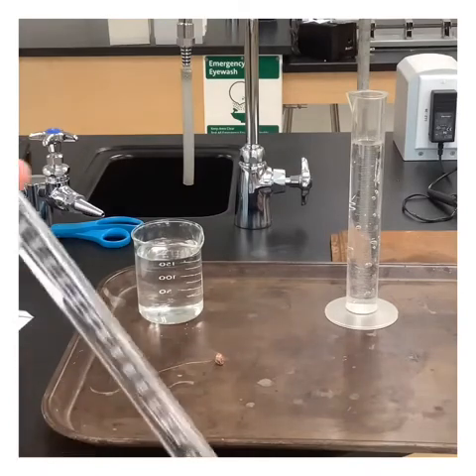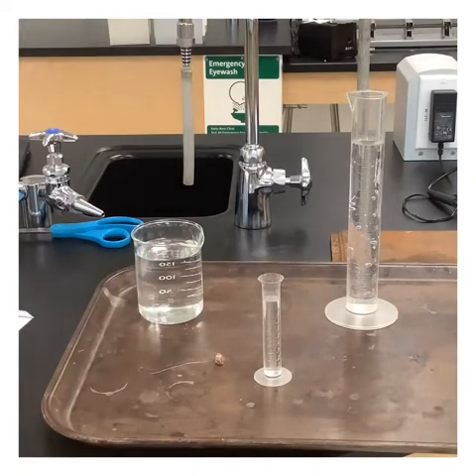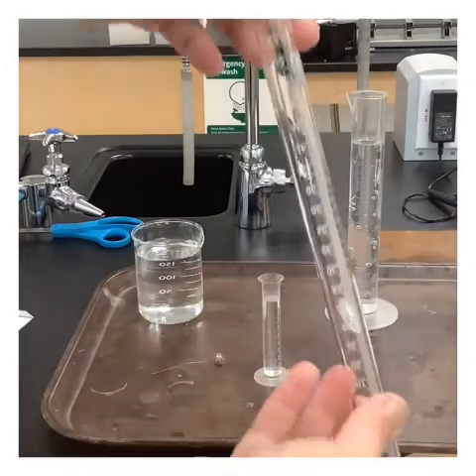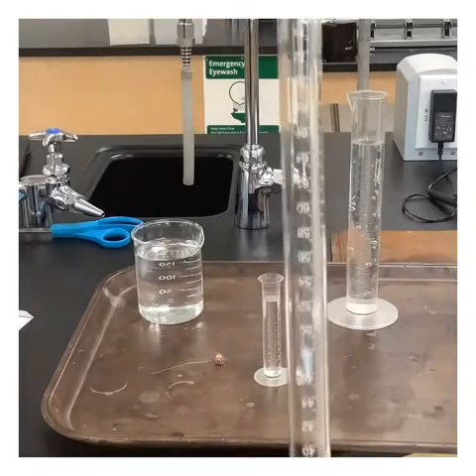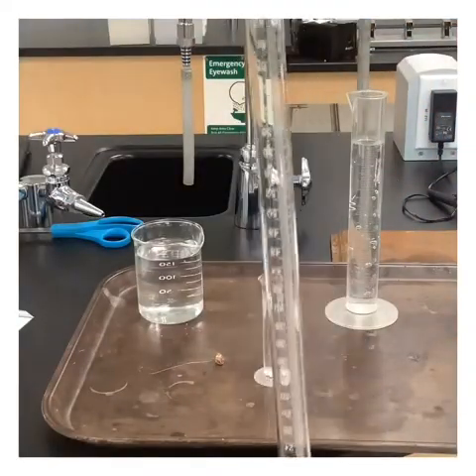We know that things that are more dense will travel to the bottom. So I'm going to start with my acid at a fairly concentrated measure. Let me put some goggles on actually. The acid is 6 molar HCl, and I have about 10 milliliters of it, so it's going to fill up the bottom. Then I'm going to gently fill this with water the rest of the way. Because the acid is more dense, it's going to stay at the bottom and the water is going to stay sitting on top. If I don't shake it up, they actually won't mix.